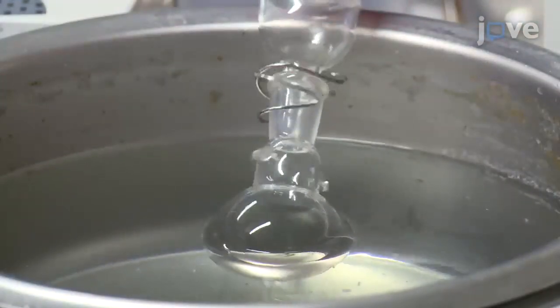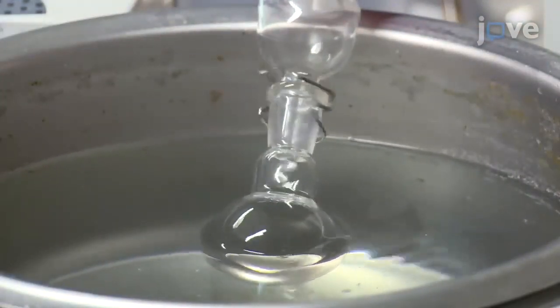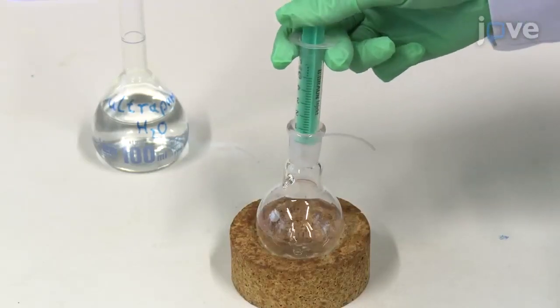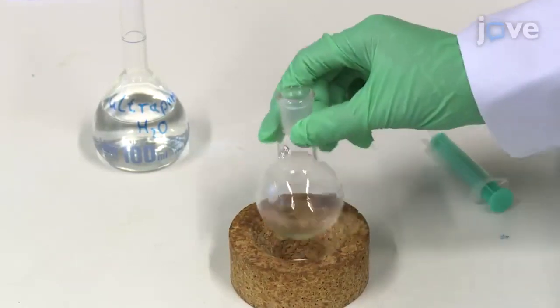Using a rotary evaporator, concentrate and dry the eluted analytes. Dissolve the resulting residue in one milliliter of ultra-pure water.